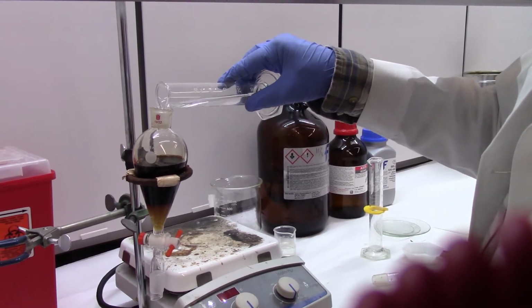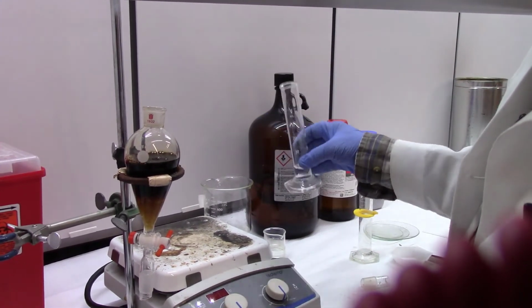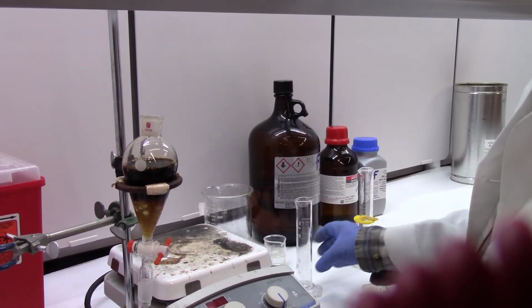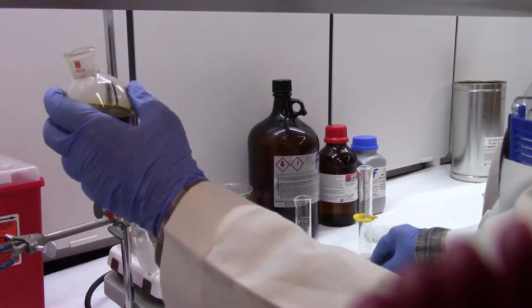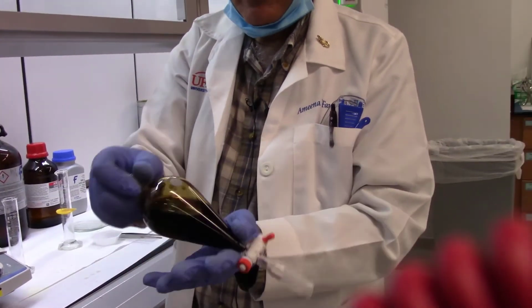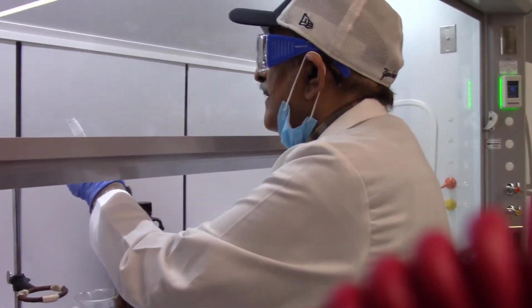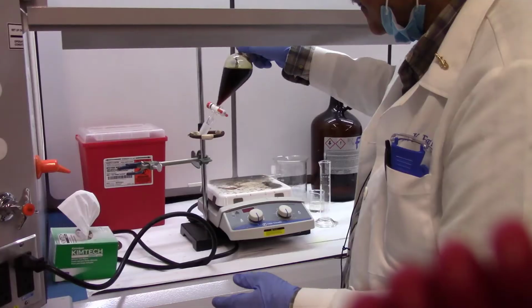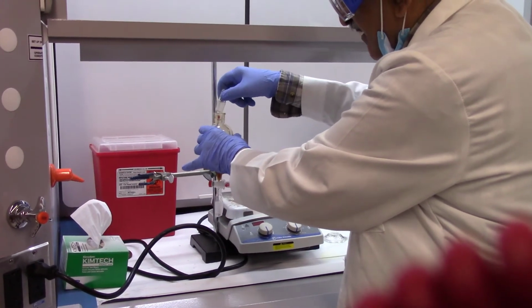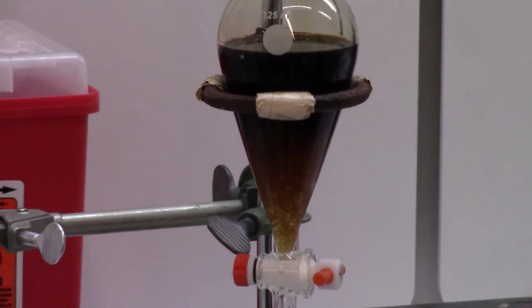Now you are going to have the second extraction. You add 15 ml more of DCM. You already added 15 ml the first time. We add 15 ml more, and you do the same thing. Make sure you don't shake it at all. You just basically swirl it, or turn it upside down, put it back, and do that like 15 times slowly. Make sure you do it slowly. Don't shake it, and then you put it back on the ring stand and remove the stopper, and now wait till the layers separate.